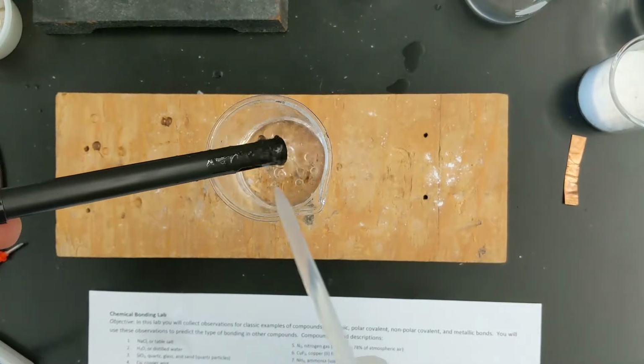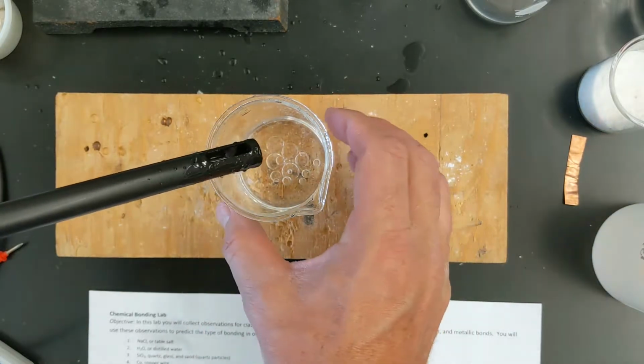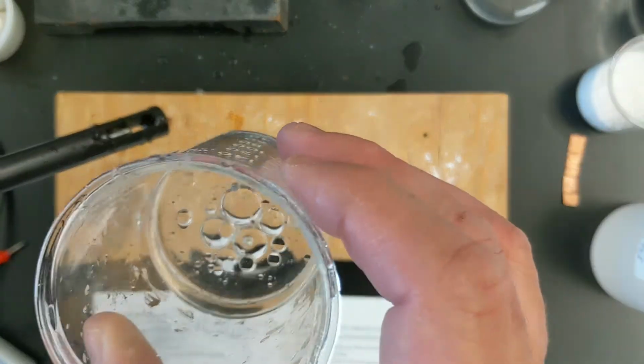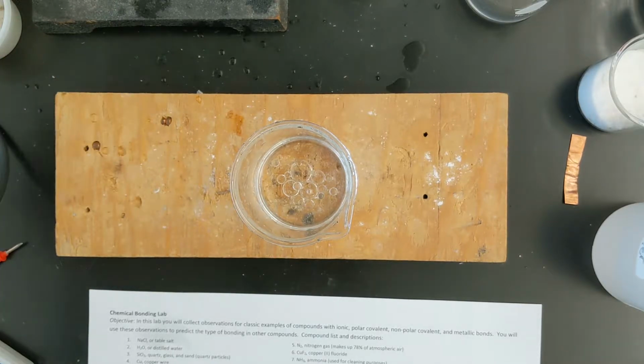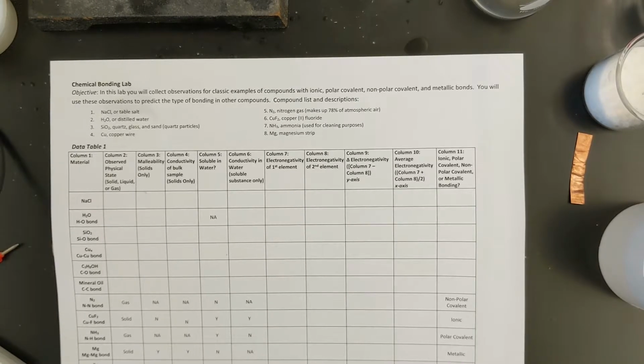And one thing you'll notice, it's very hard to clean this probe off now. That's because this is an oily substance, and you start to see the bubbles forming where they're separating there too. Those are just water bubbles. And so this is, again, just to show you that it's not soluble in water. Okay. So we've gone through all the different types of tests. You do need to know how to do these, and you will do them in the lab next time.